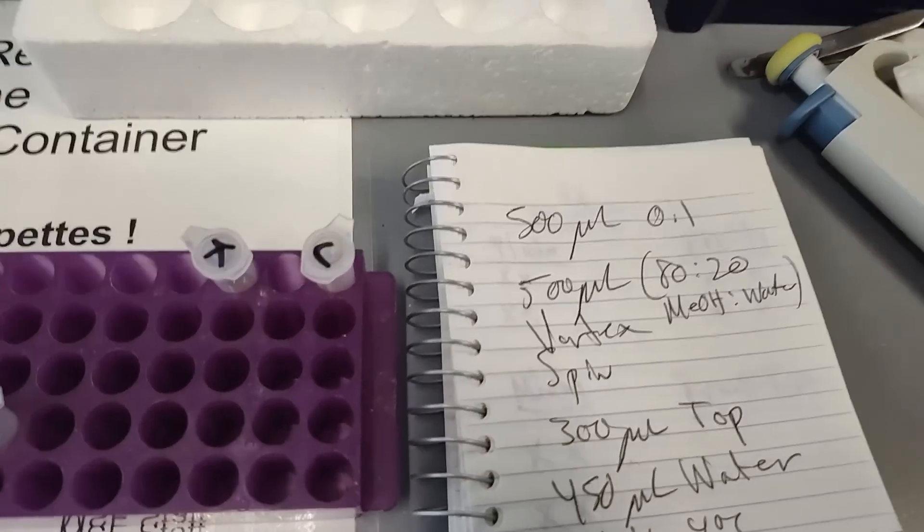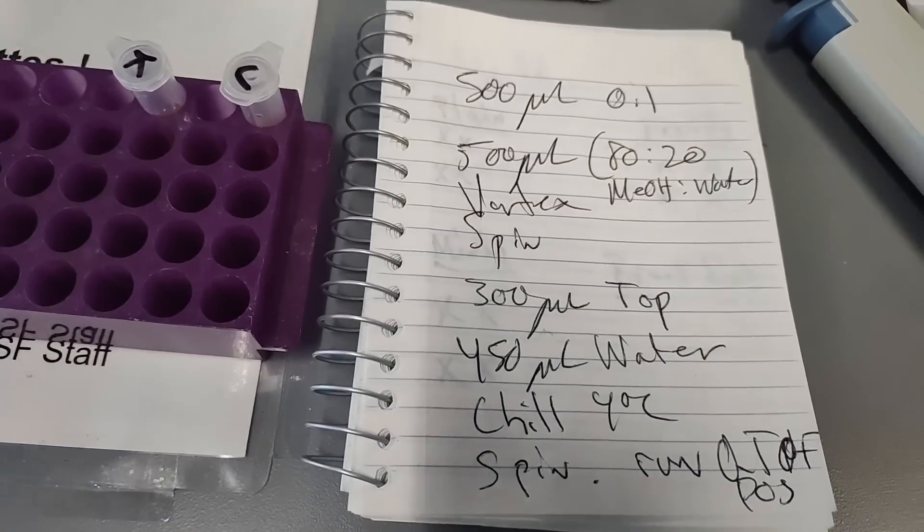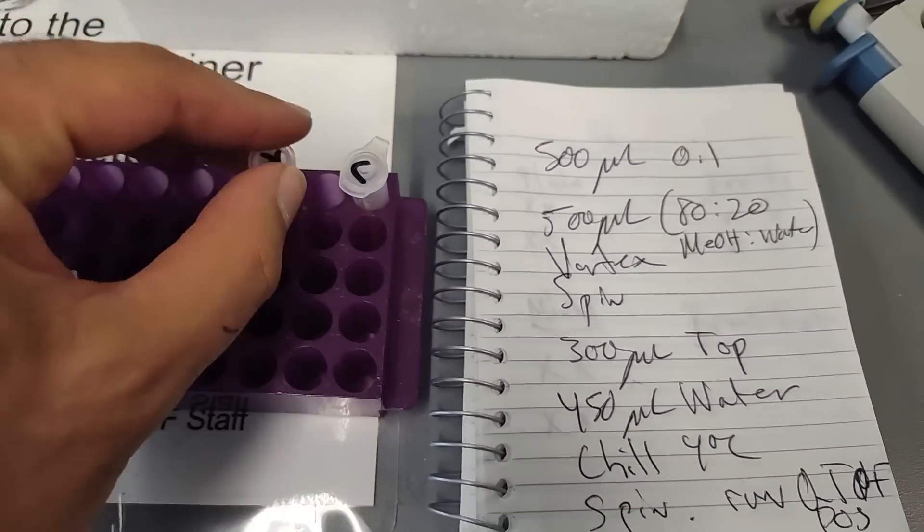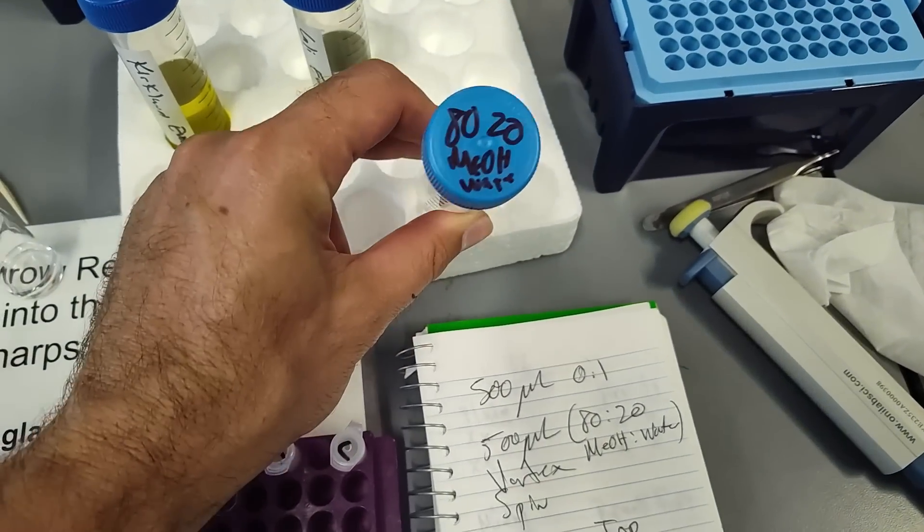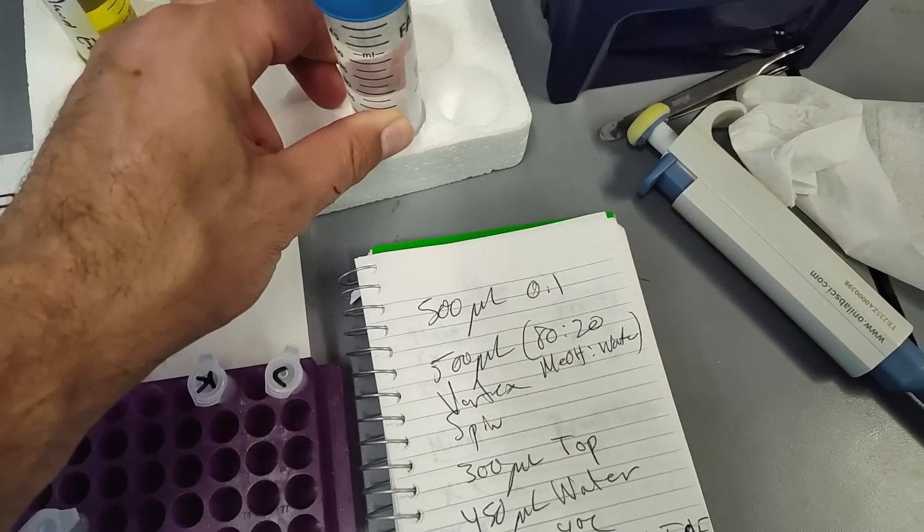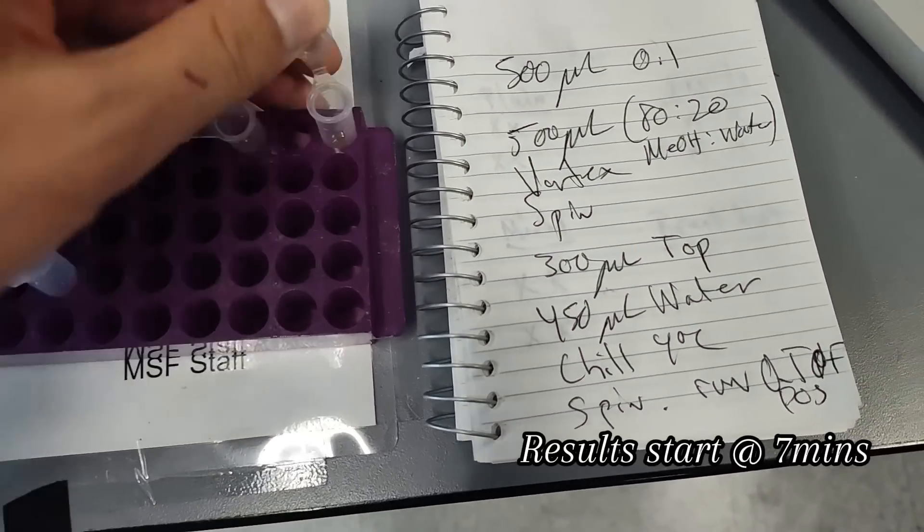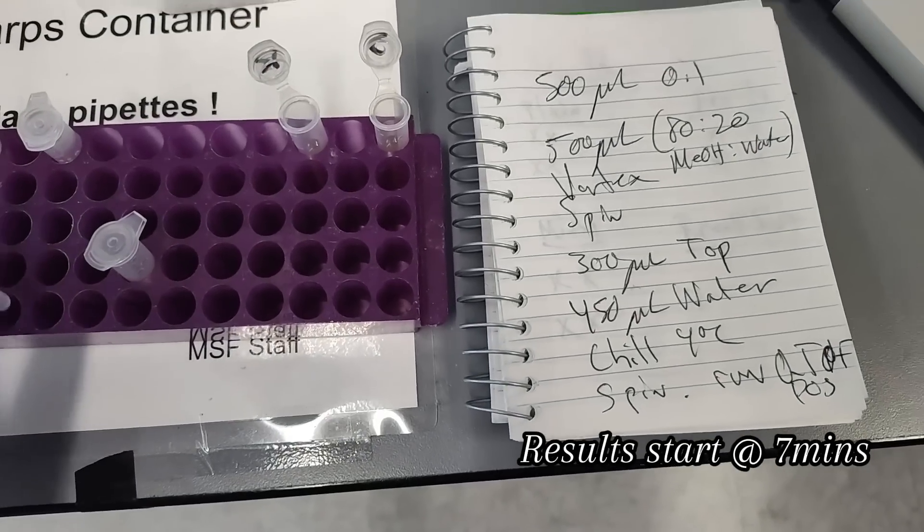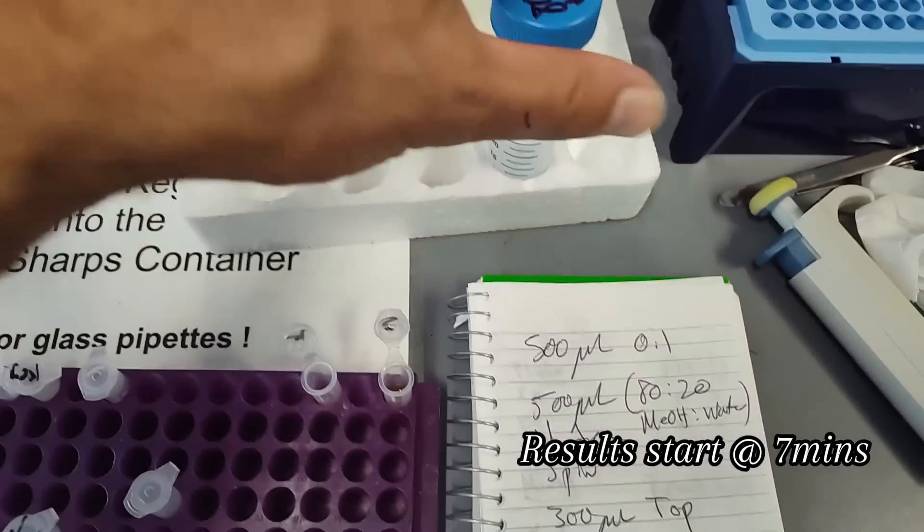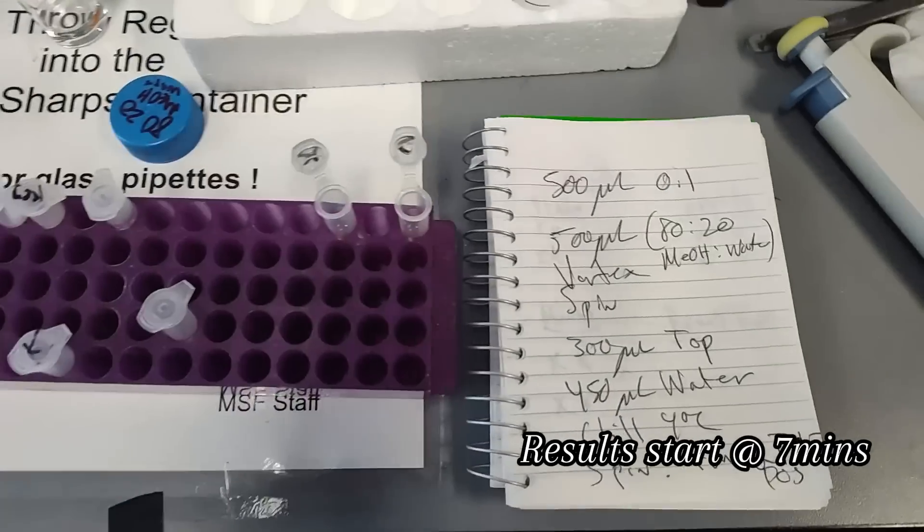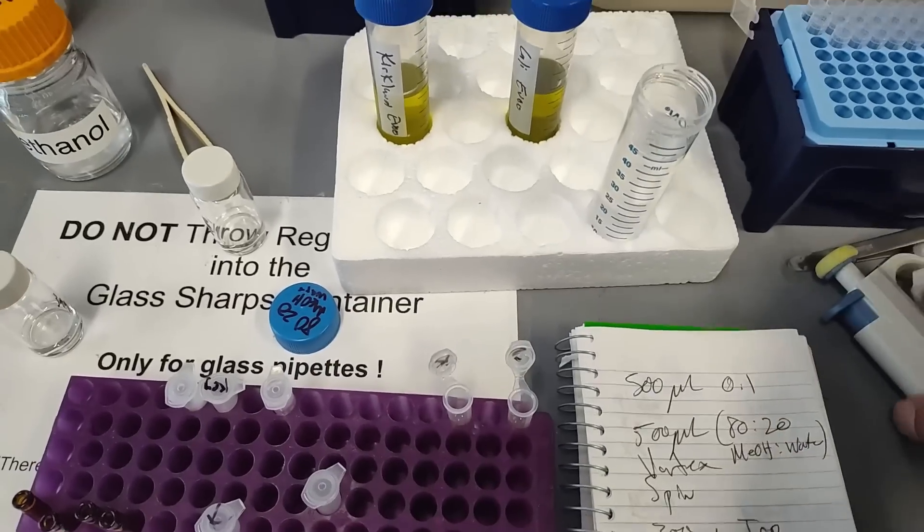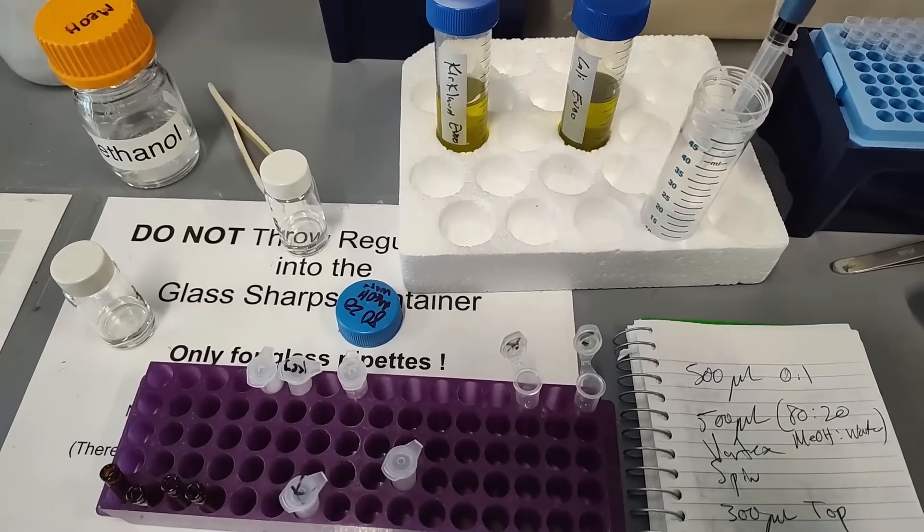Here's the protocol in case you're following along. So we need to add now 500 microliters. I've pre-made up 80-20 methanol water. So 80% methanol, 20% water. So we've got a nice stock tube of this stuff to use. And so now we're going to go ahead and just put 500 microliters of that into each tube.